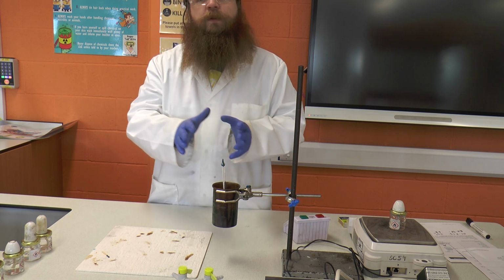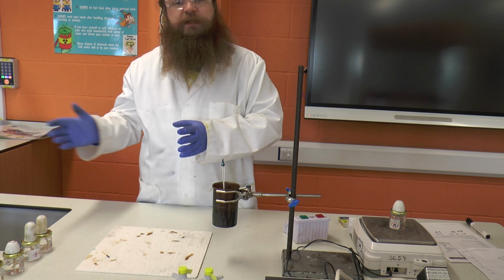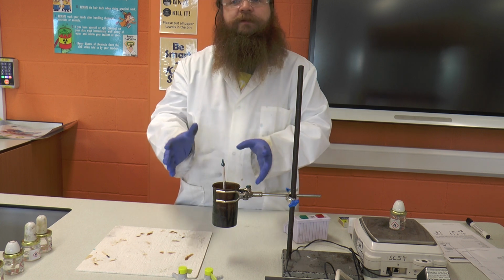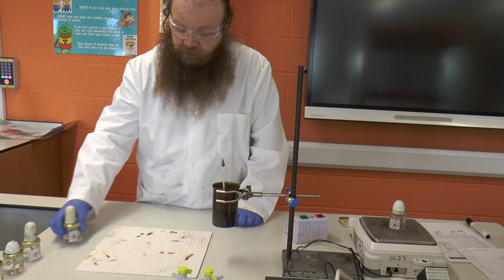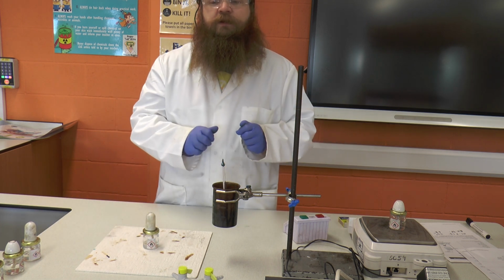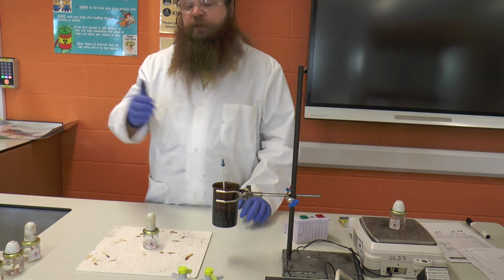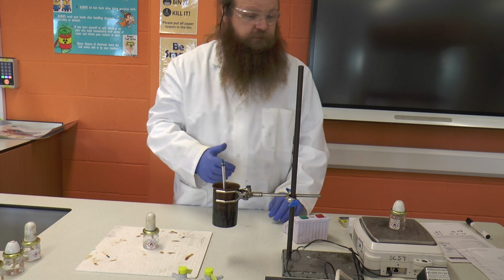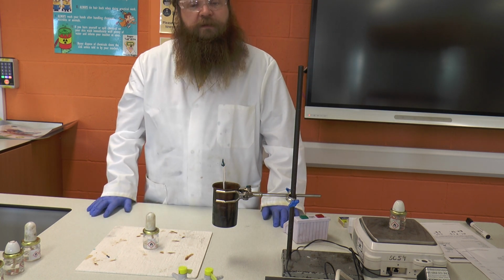Okay, and obviously we want the can to be cool when we start. So obviously cleaning it and running it under the tap or allowing it to cool will help with that. And then we're going to repeat that for the other alcohols. So we would do exactly the same for propanol. We would weigh it, we would set it up, we would burn it, we would measure the change, we would weigh it again, and we go on through all 5 alcohols. Okay, till we've got a nice set of results. Alright, thank you very much.